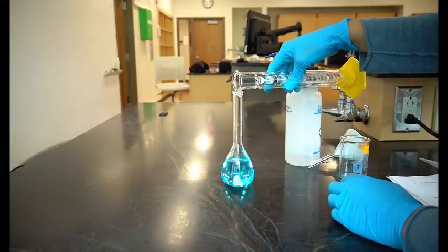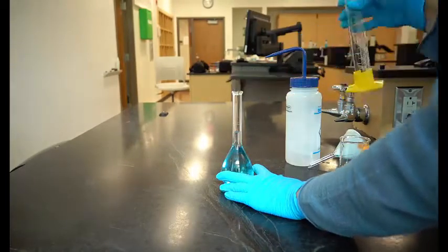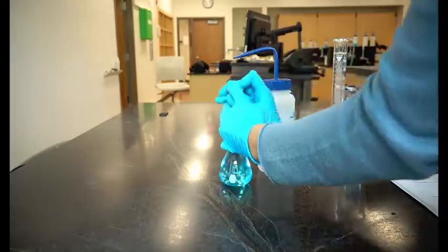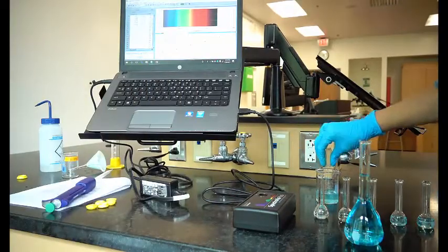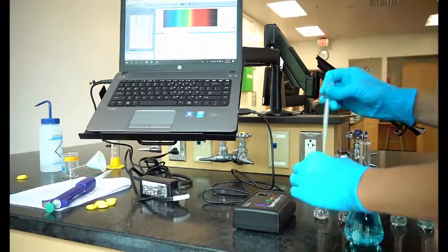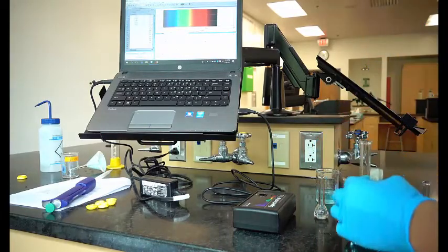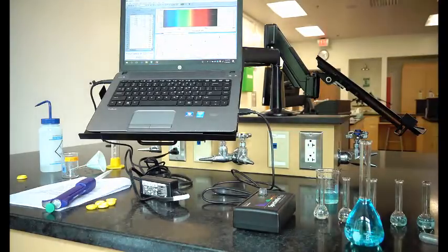You are ready to find the concentration of copper in that sample, step 4D. Dilute the sample to the 100 milliliter line with water. Rinse a cuvette with this sample, then fill it 2/3 full and place it in the spectrometer. You do not need to push any buttons, just read the absorbance in the corner and record it in your lab notebook. Repeat this reading 5 total times.